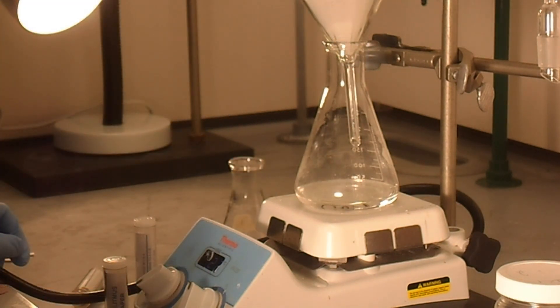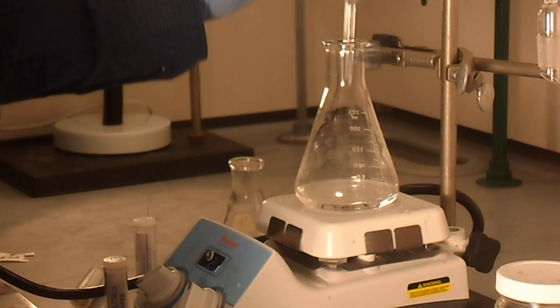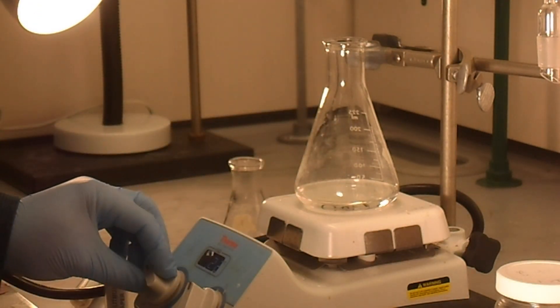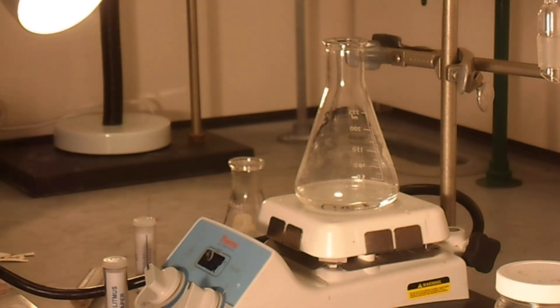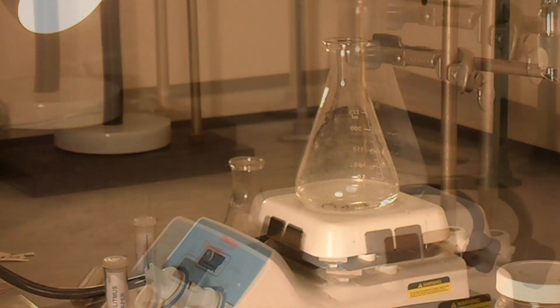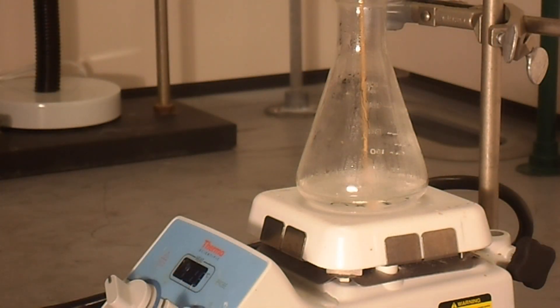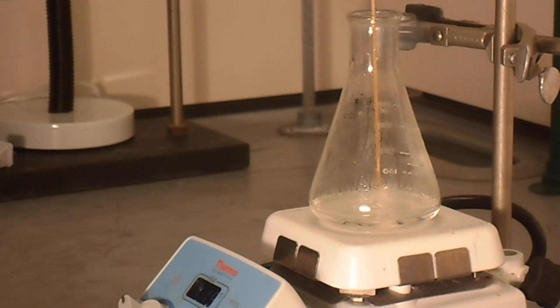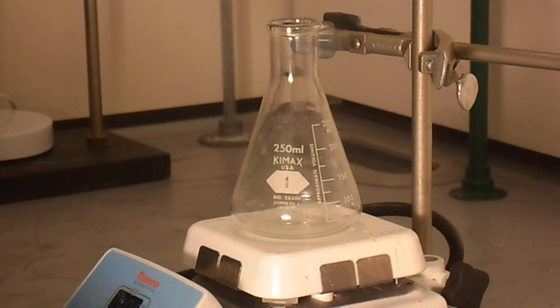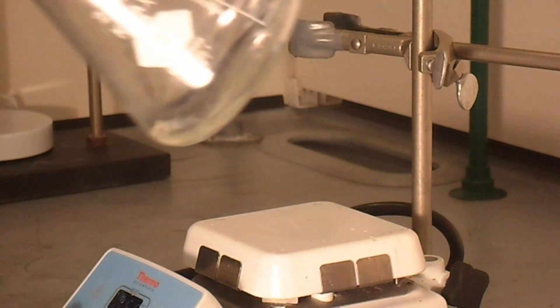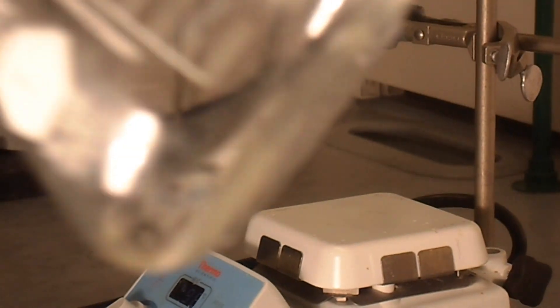Once our solution has been gravity filtered, we're going to evaporate off the DCM. So our DCM has finally finished evaporating. We can take it off the hot plate. There's not that much liquid left. It's a very small amount. It's hard to see in there, but it's there.